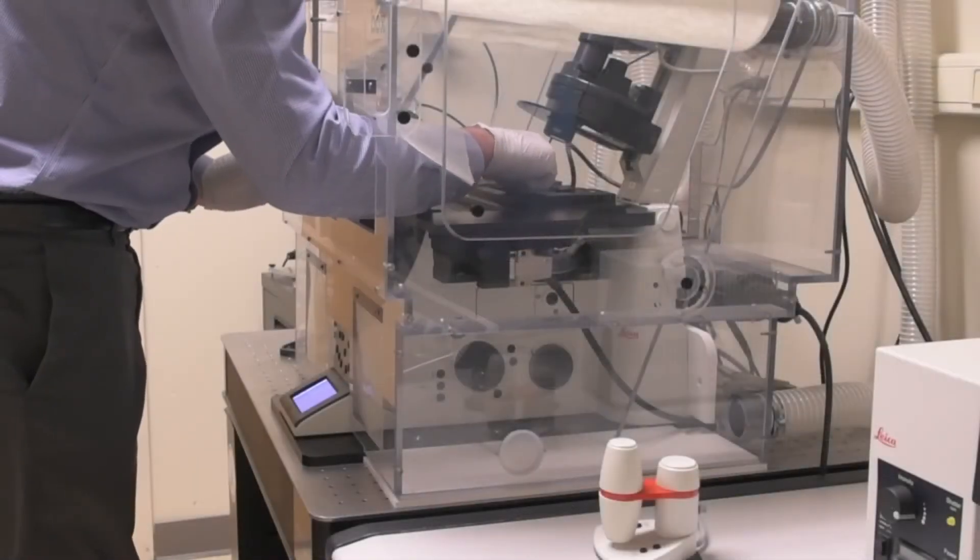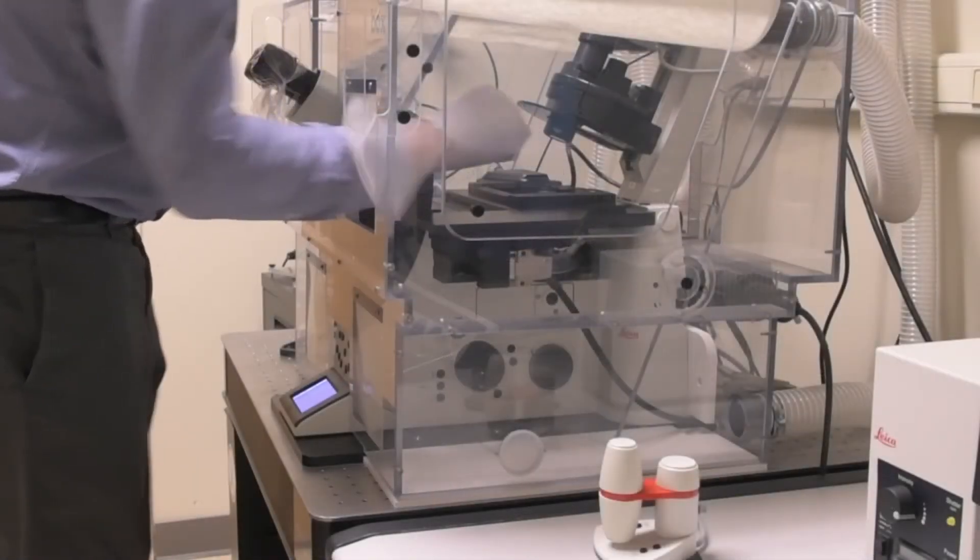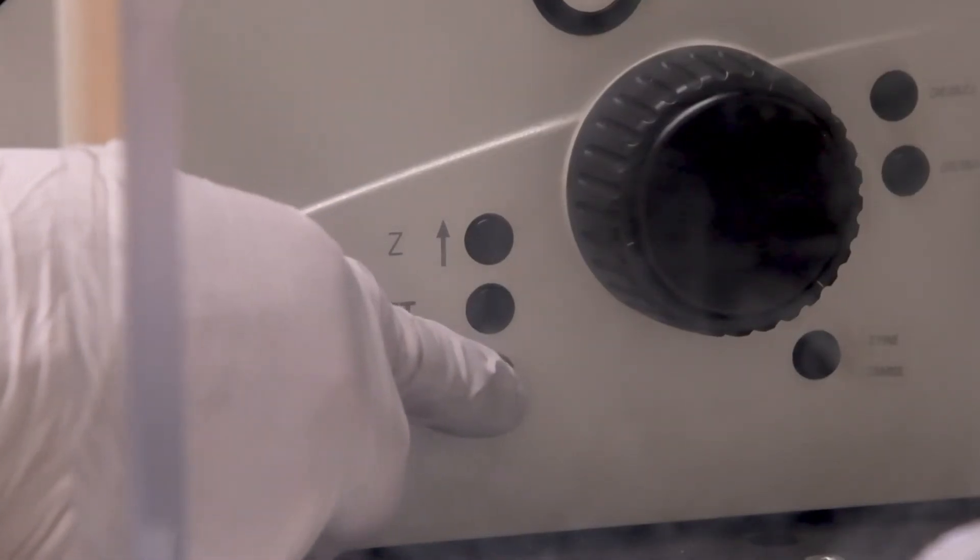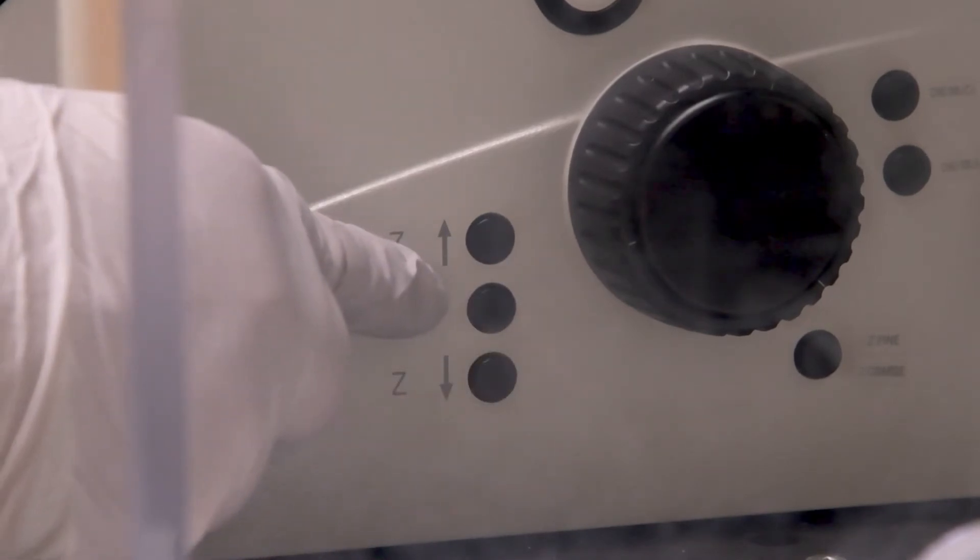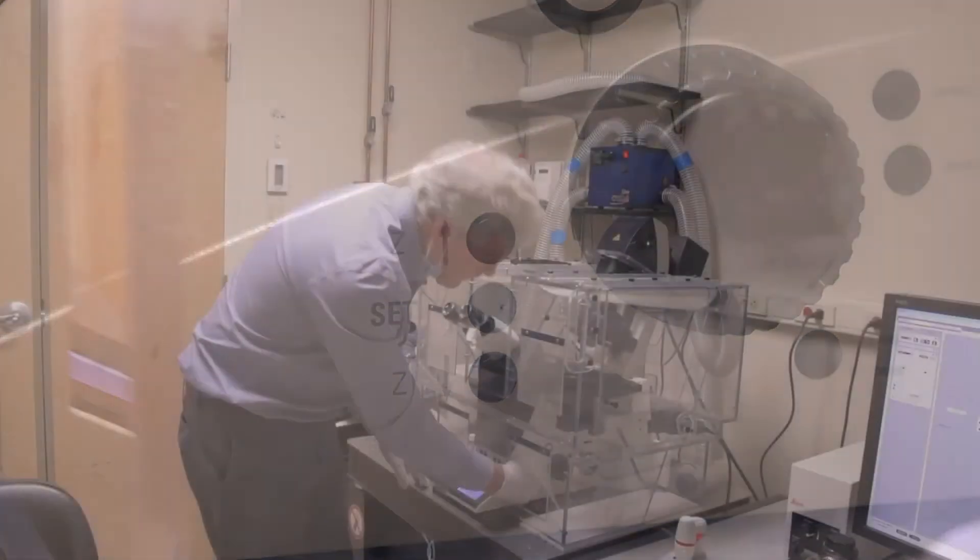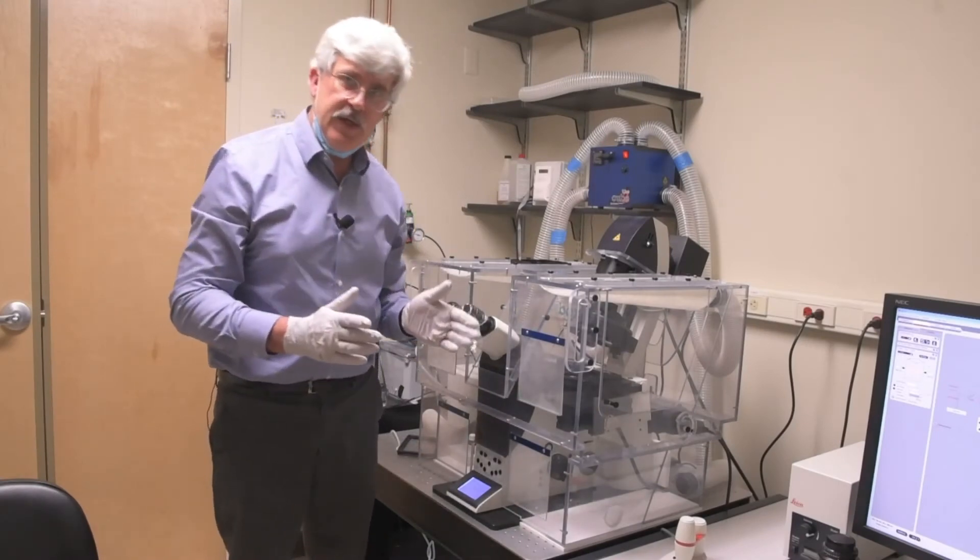The last thing to do here is to lower the lens to the bottom position again. So, back at the three buttons on the right side of the scope, push and hold the bottom one to bring the lens all the way down. Remember to never click on the middle button, as that can change and reset the zero position. So now that we have the lens that you want and it's ready to use, let's turn our attention to your sample.